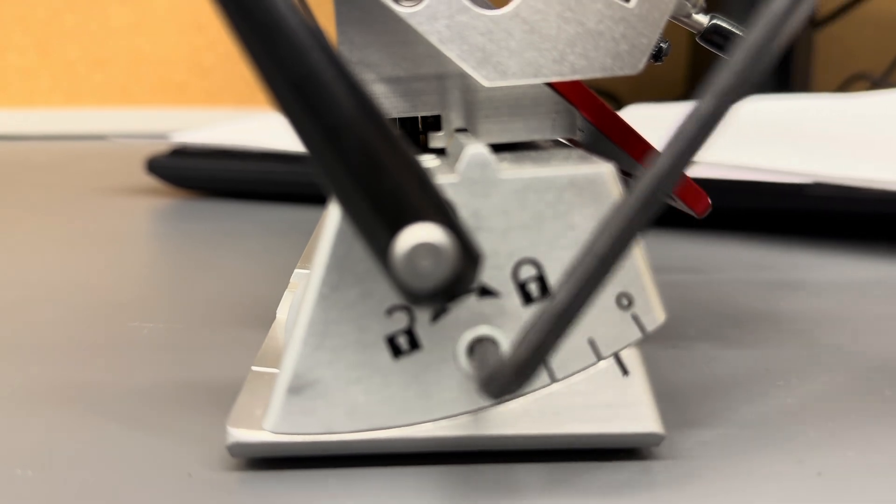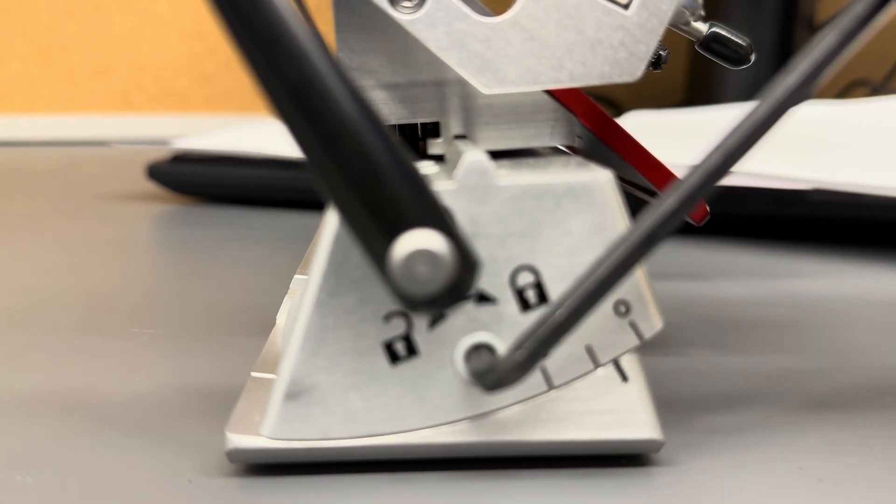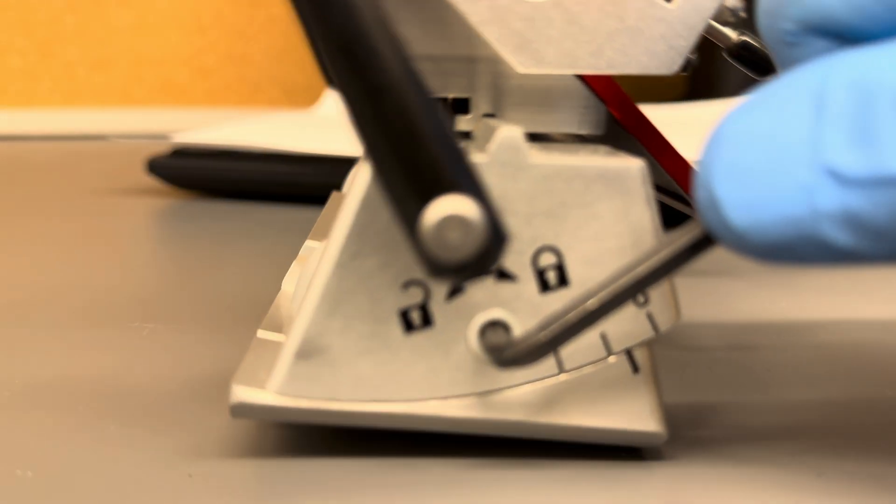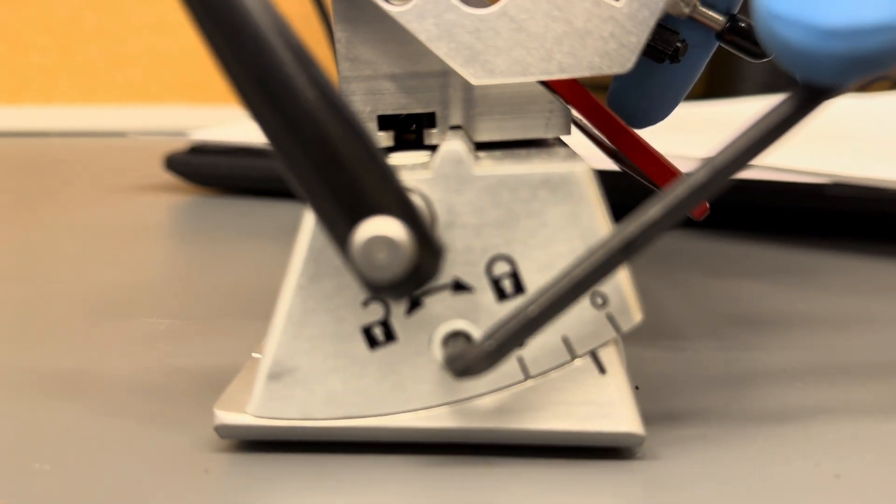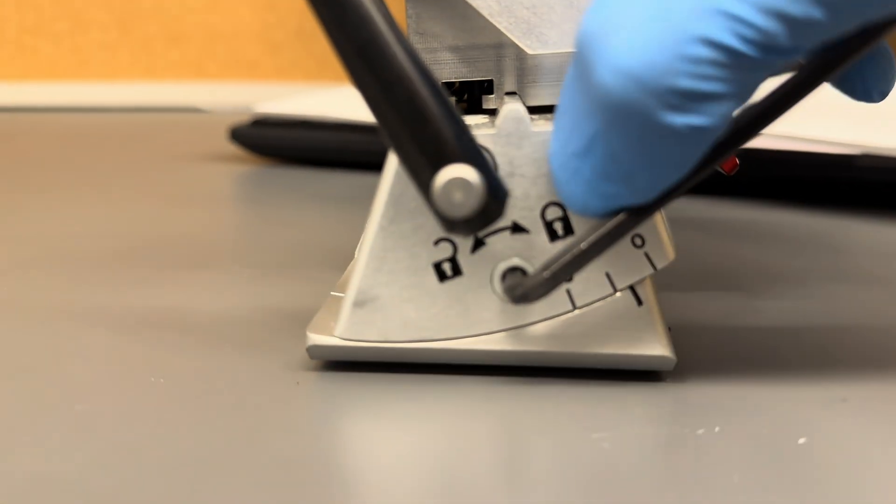So anyway, I just wanted to show you guys because I ran into this. This lab actually had this loose, and I don't think they even knew. This is not a histo lab or Mohs lab, this is a research lab.